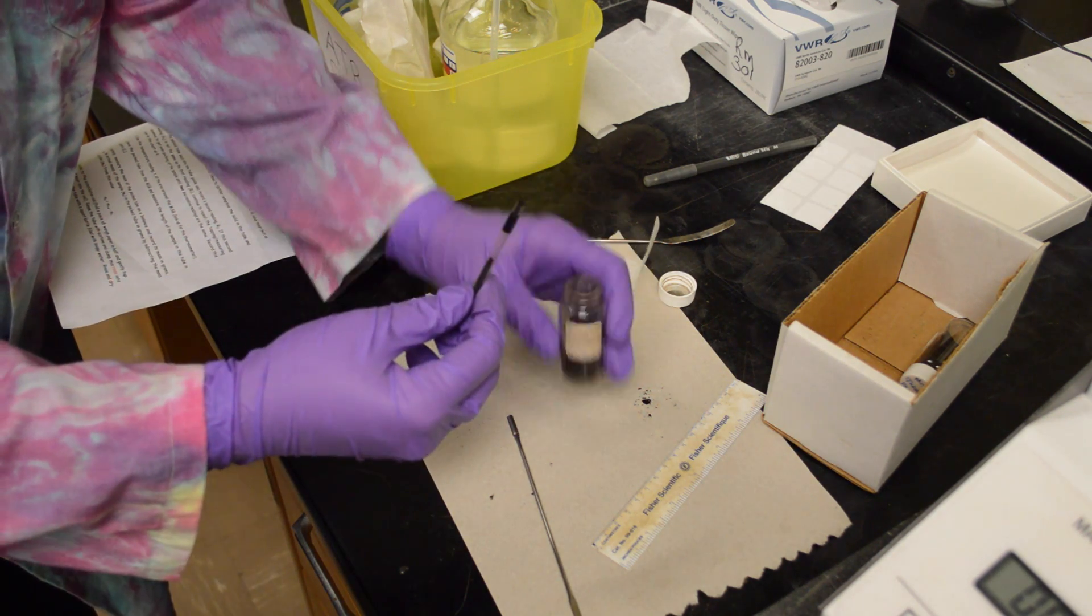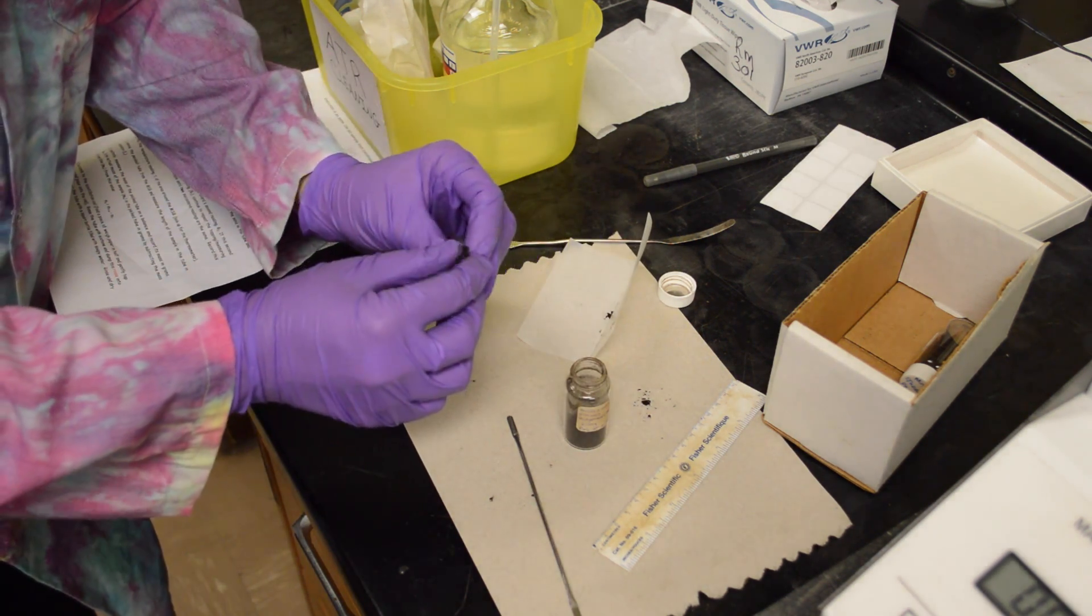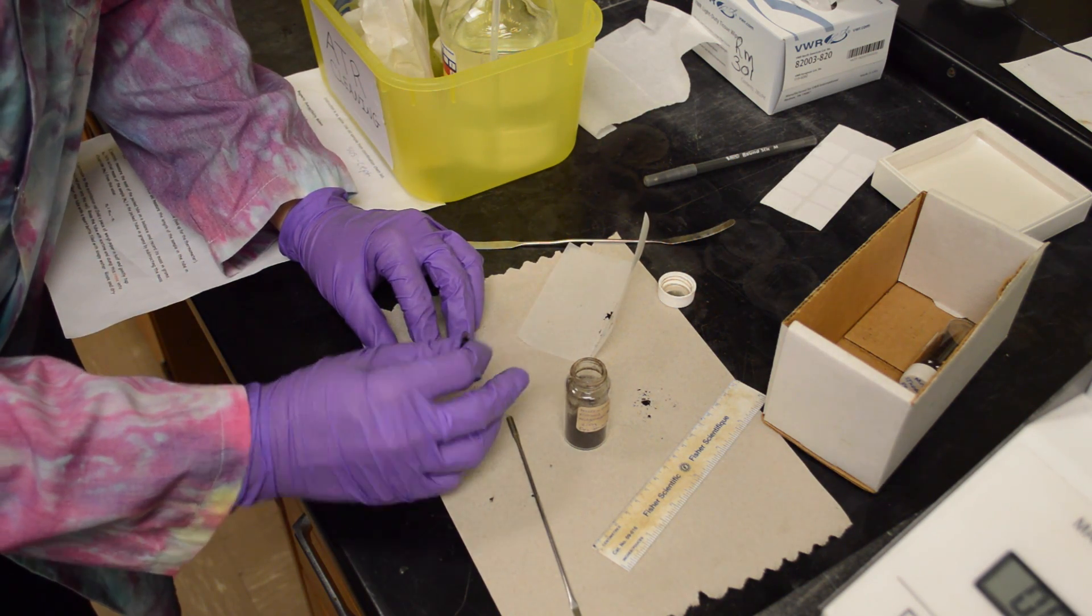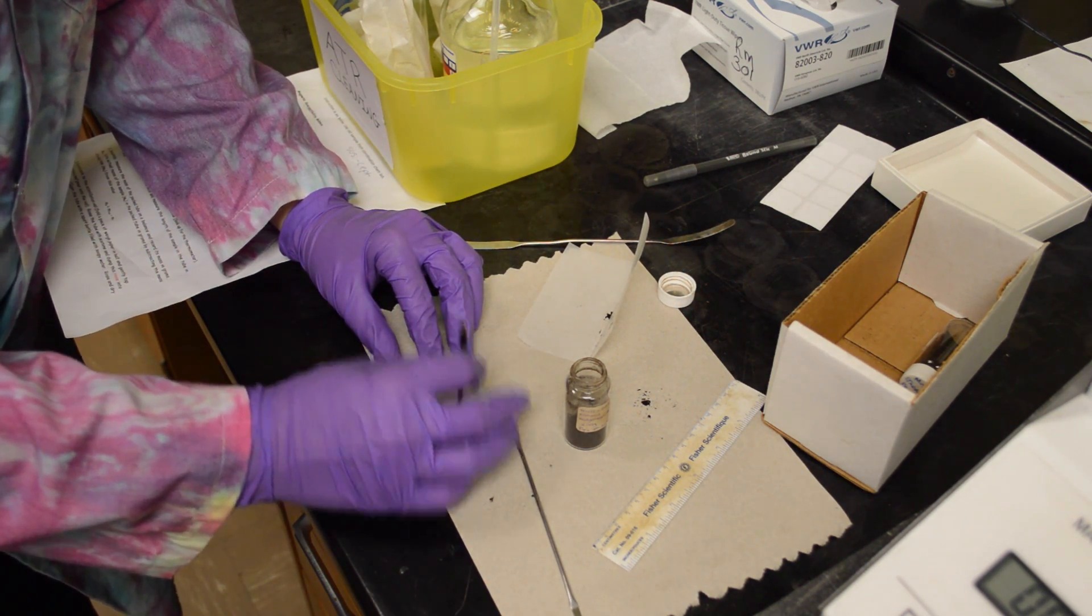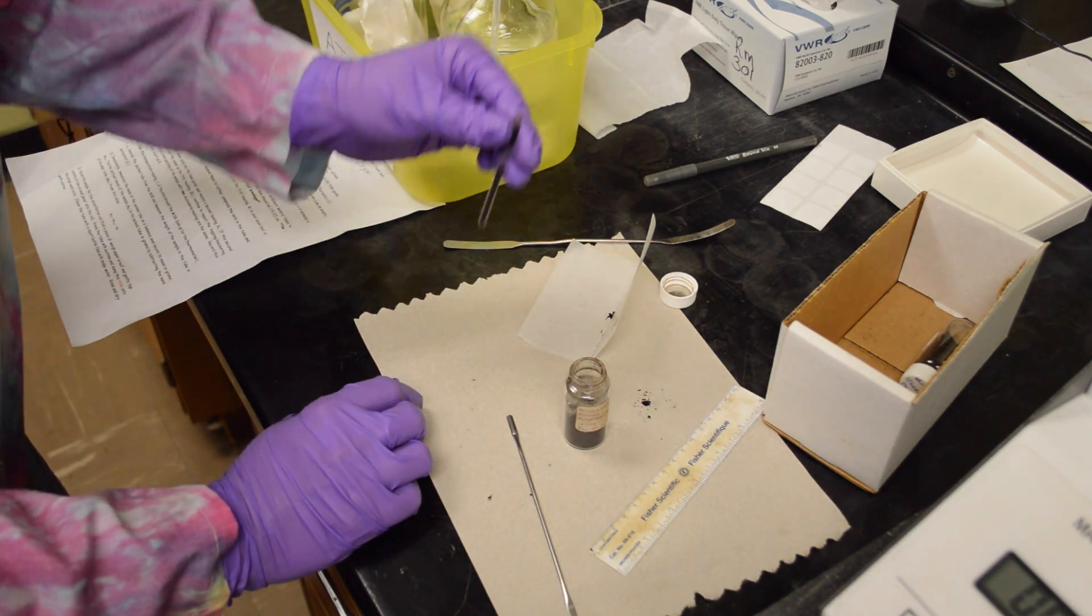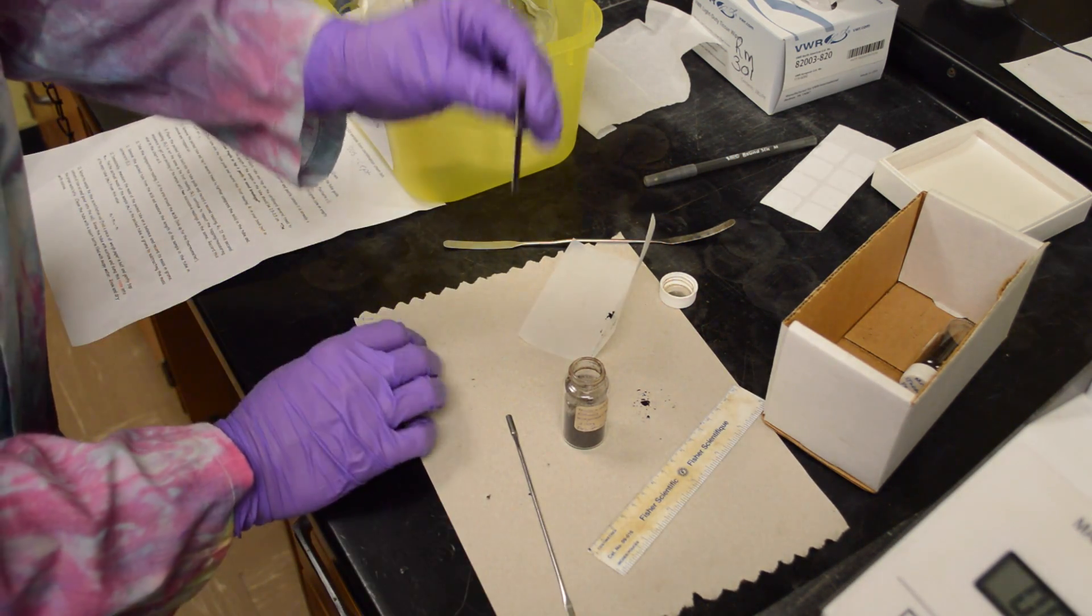Every time you add sample into the vial, tap it down to compress it. At the end, you should have about 3.5 centimeters of product in the tube.